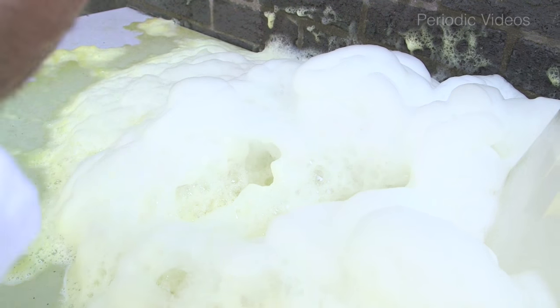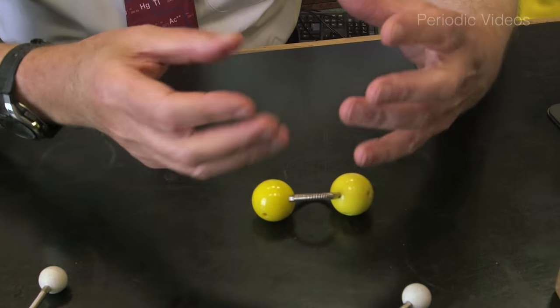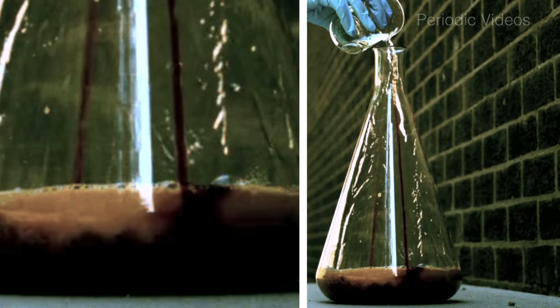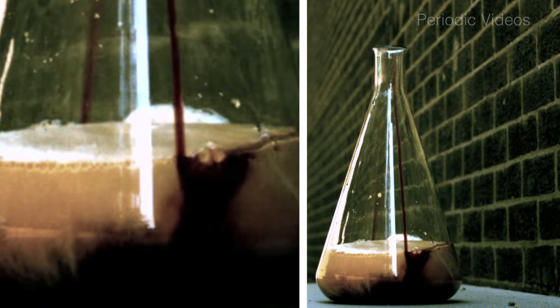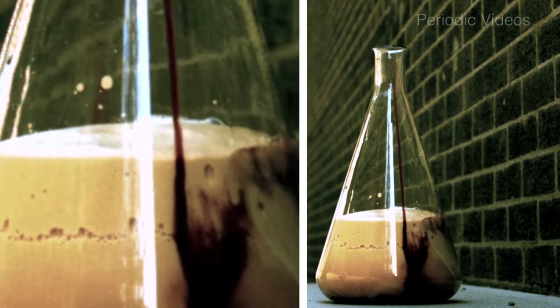What he's doing now is actually using the oxygen of the foam to keep that splint lit. If you look at the reaction products, oxygen is a gas. So you've got a liquid that is producing a gas which has a much bigger volume than the liquid. And also because the reaction mixture is heating up, you're also producing some steam — that's the vapour of water — though the volume of steam is probably much less than the volume of the gas. The material needs to expand because the gas is at high temperature, so it expands, and by having soapy solution you can make a foam so people can actually see the gas expanding. The reaction would work just as well without the soap, but then you wouldn't see the oxygen coming out.